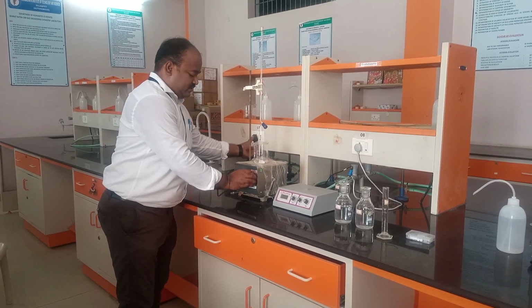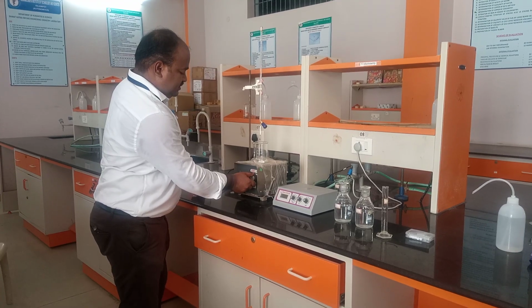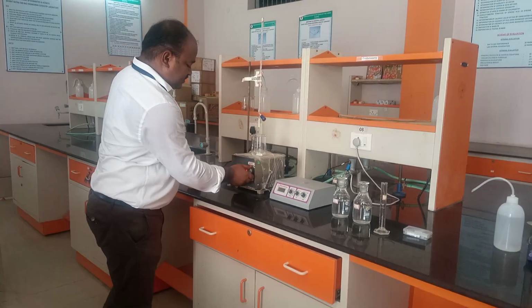Let's switch on this one, and we can capture this one.